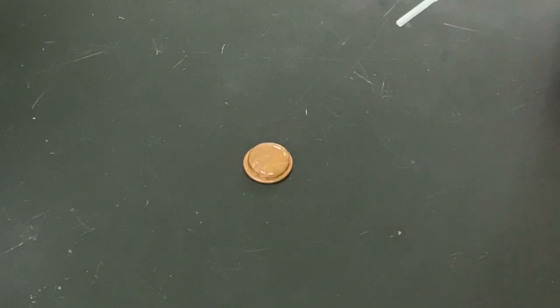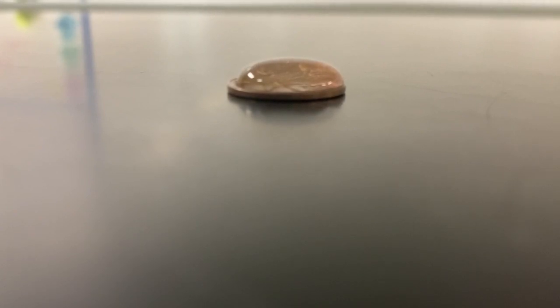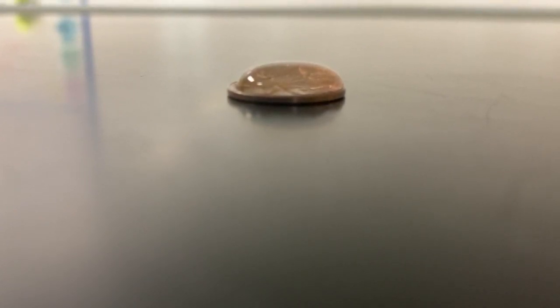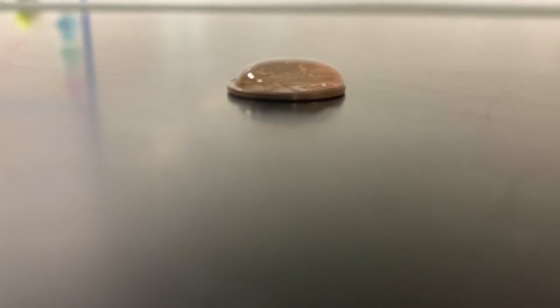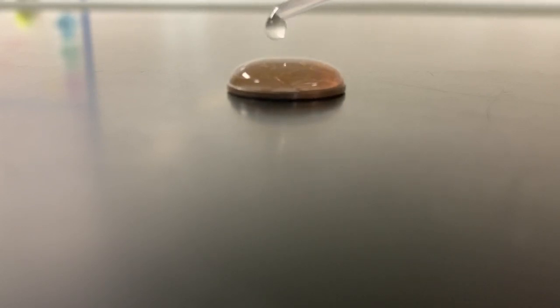All right, I'm going to take a moment here to take you to the side view of the penny. All right, now we're at the side view of the penny, and you can really see it's making a dome shape on the top. And it's starting to try to come towards the edges a little bit. Now, the penny does have a design where it actually has a little raised up edge. So I'm going to keep adding water, and notice how it bounces around as it comes in. I'm going to see if I can get it to actually overflow the edge without spilling.